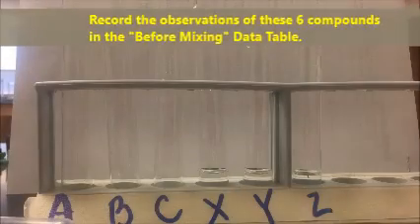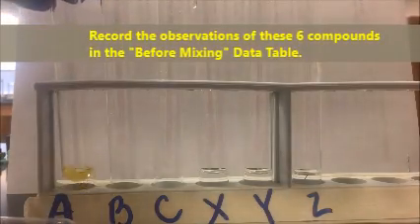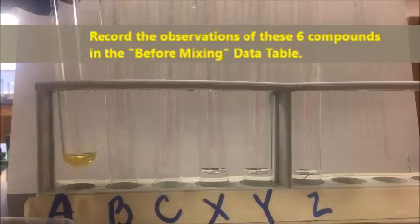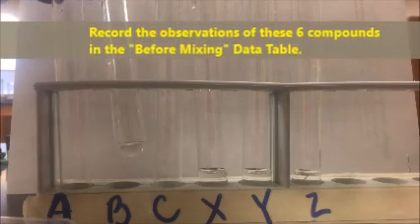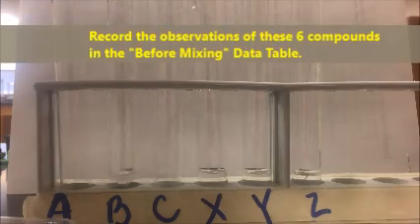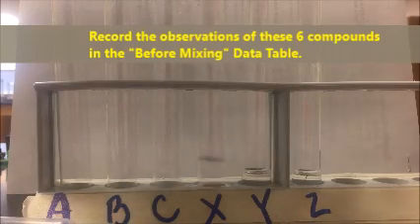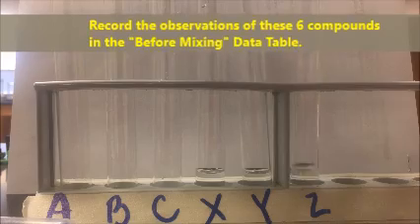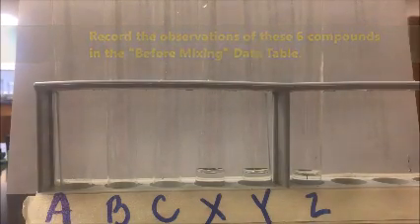Hopefully you can see that all of the compounds are clear liquids except for compound A. Compound A is a yellowish gold liquid. Compound B, I guess, does have a very, very slight pinkish tint to it, but all of the other compounds are clear liquids. So that is what you would write in for your appearance for samples A through Z.